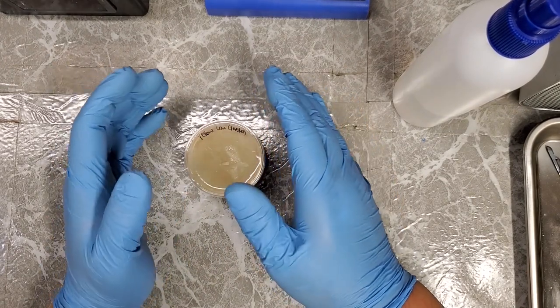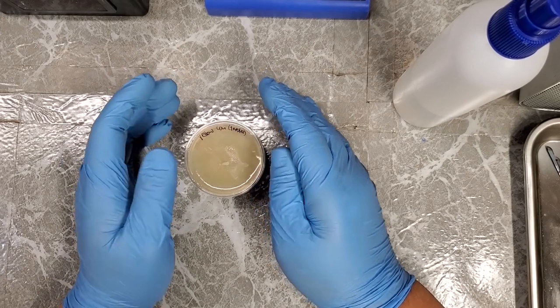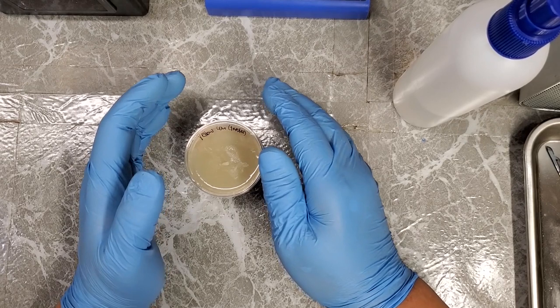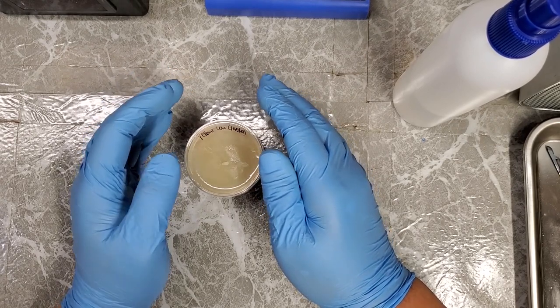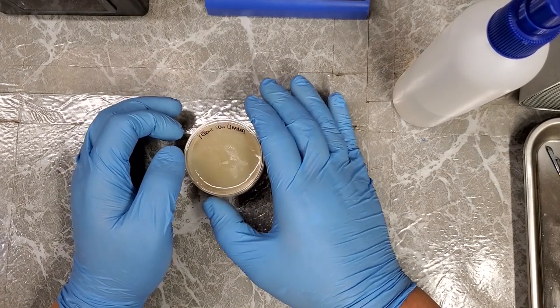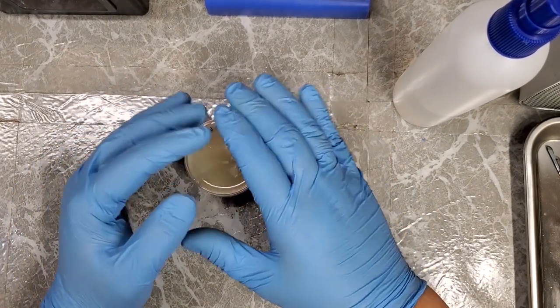The thing I like about my new lab incubator that I purposely bought for incubating Petri dishes is that I don't have to worry about fans and stuff because it's a gravity incubator, purpose built for incubating Petri dishes. But yeah, we're going to let this colonize for about 3 days before wrapping them, and then I will put them back in upside down to continue colonizing.